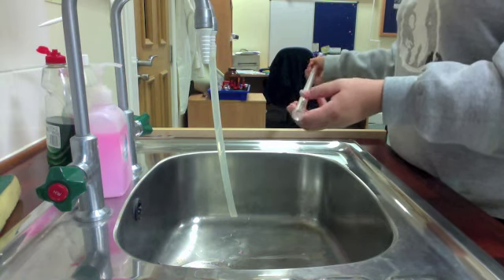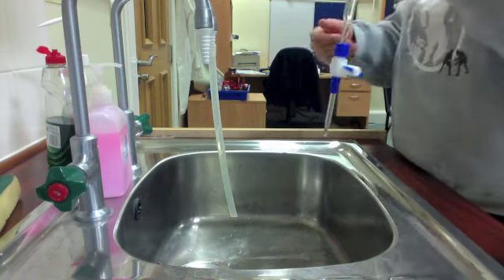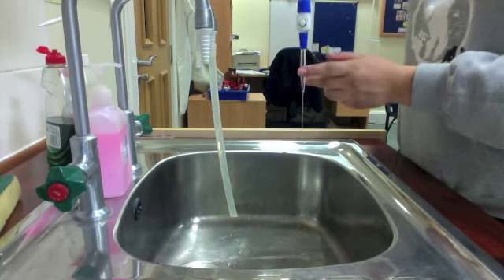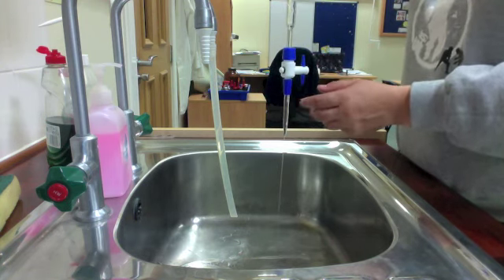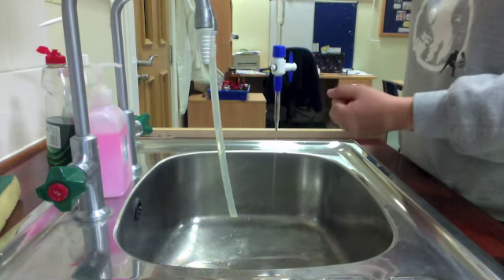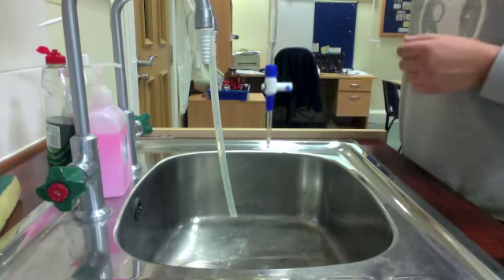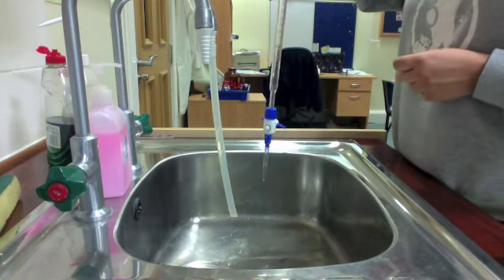Now this stuff is fairly dilute, so that's why it's okay to be in the sink. Not ideal, but it's okay. And then again, run through the tip as well, so that what is remaining in the tip is sodium hydroxide, which I'm going to be using for my titration. Run that all through. And now my burette has been prepped, and I am ready to fill it with titrant and start my titration.